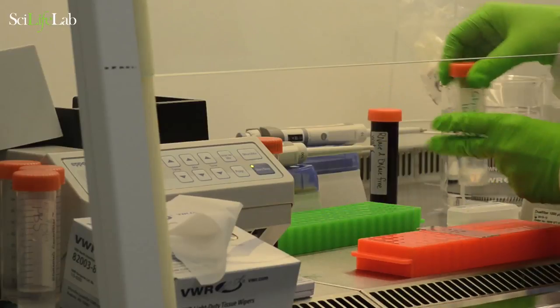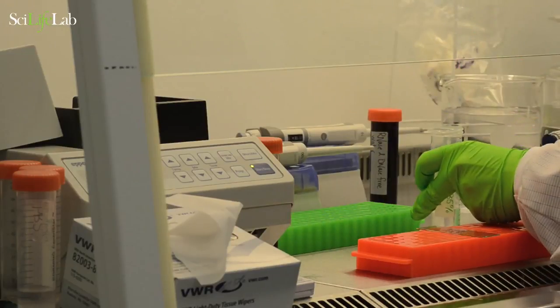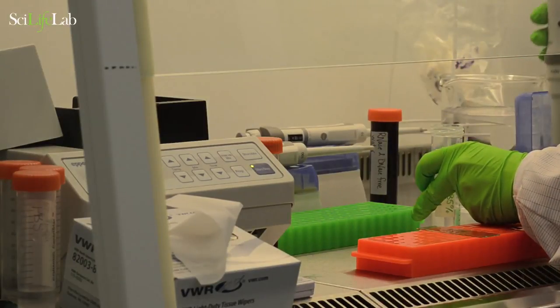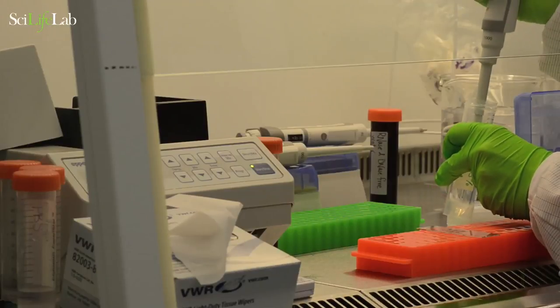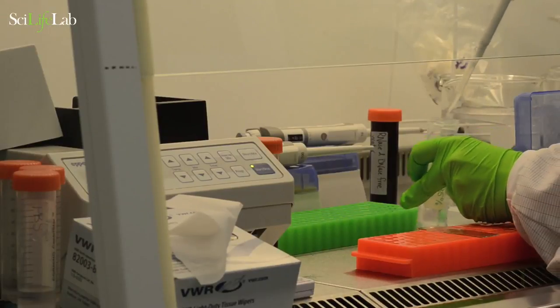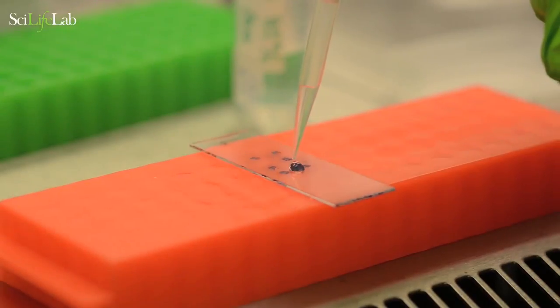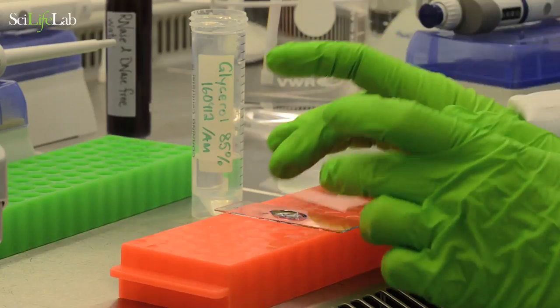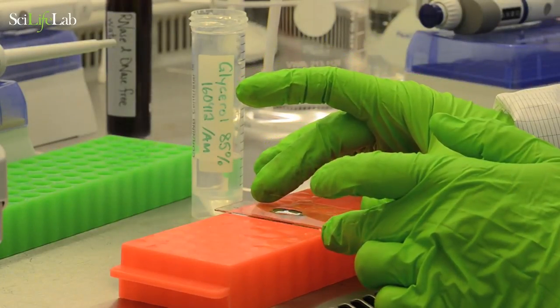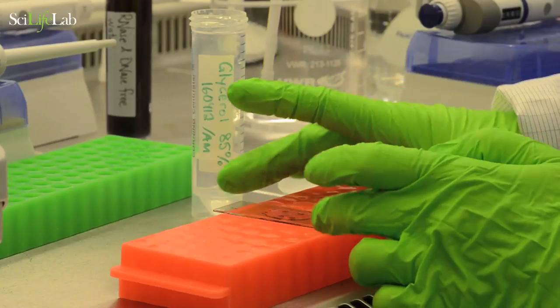Prepare the slide for imaging by adding 280 microliters of 85% glycerol as a mounting medium. Carefully add a coverslip. Now image your samples using brightfield microscopy.